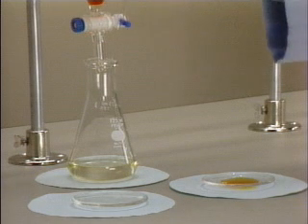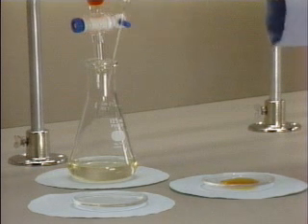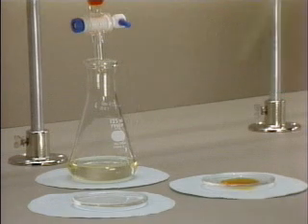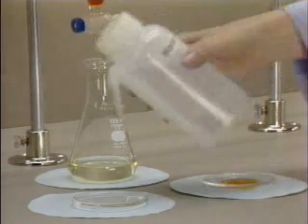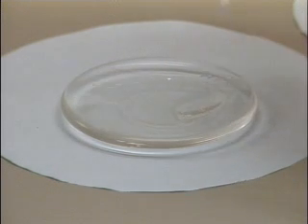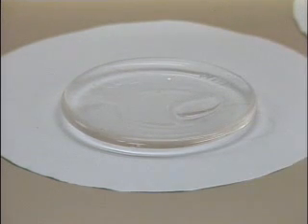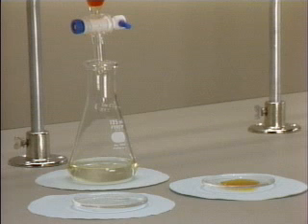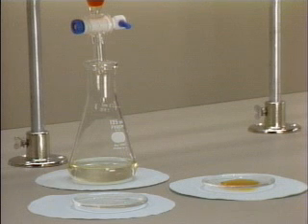If the water is not miscible, the layer is the organic phase. Although this might seem obvious, care should be taken not to accidentally discard the layer containing the desired compound. Both in student laboratories and research laboratories, many products have been thrown away by mistake.